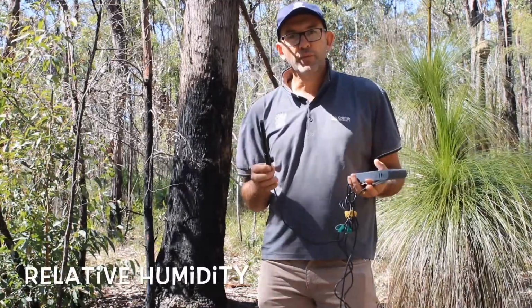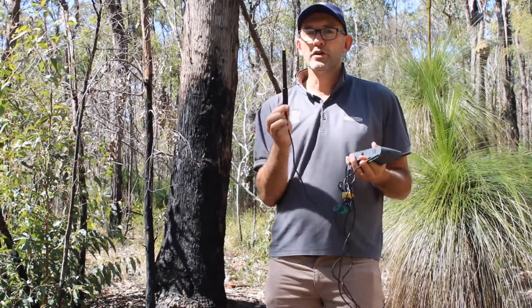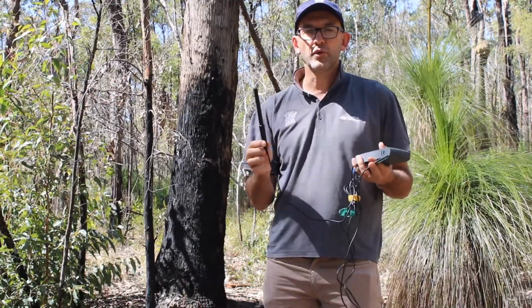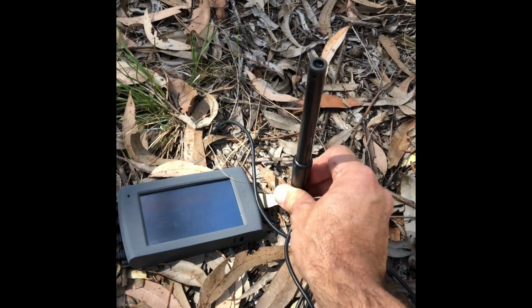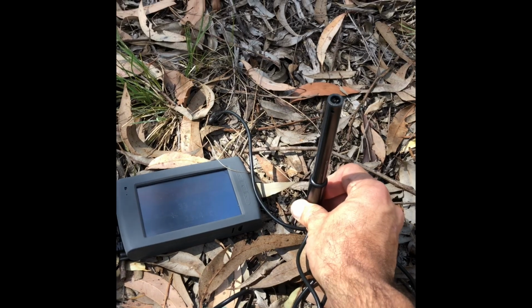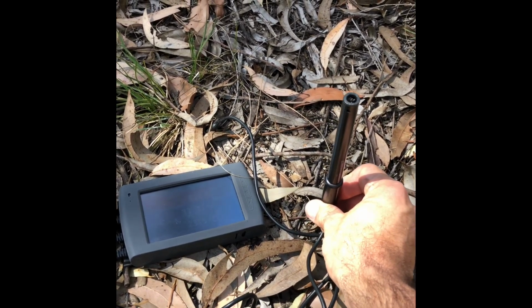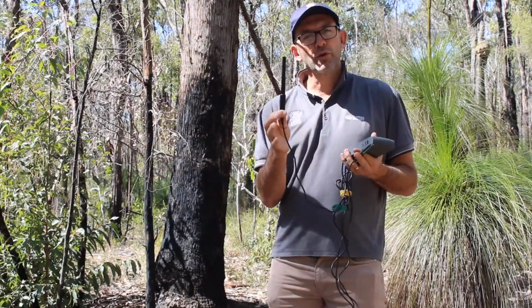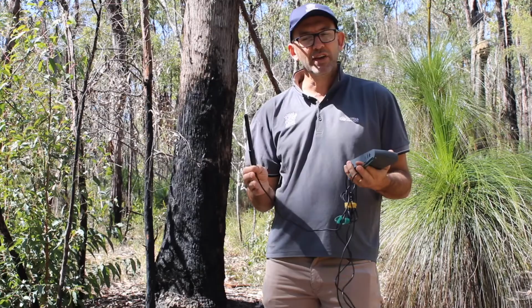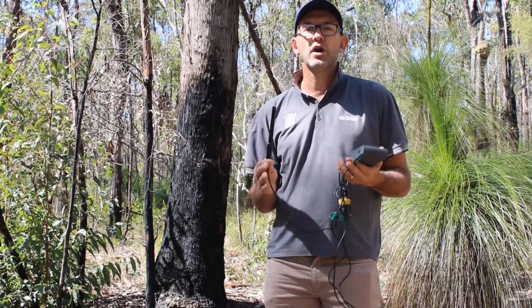The third probe you're going to be using is humidity, or measuring relative humidity. Now when you measure relative humidity, it's really important that you do two things. The first thing is that you actually hold this low to the ground. On a day like today, which is a little bit windy, the humidity will be blown away, and it won't accurately measure the humidity that would normally be here. So we hold this low to the ground because moist air is heavier and will actually sit close to the ground, and the wind doesn't necessarily blow that away.